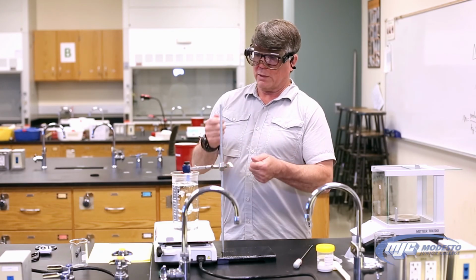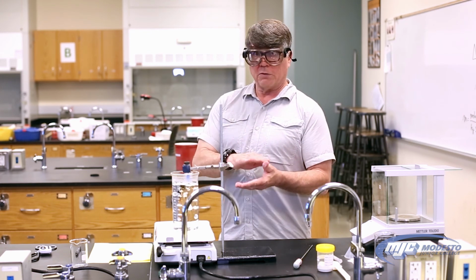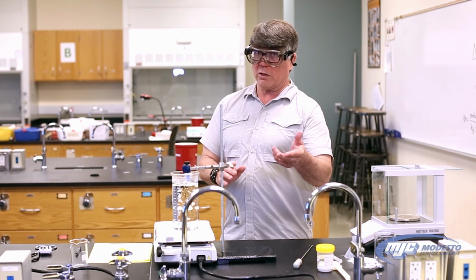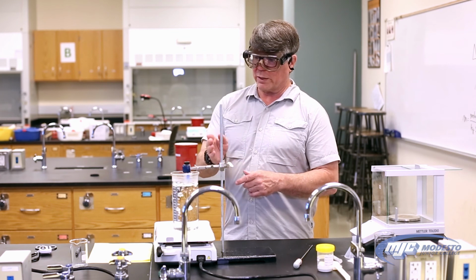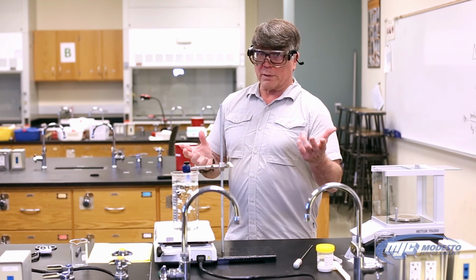Going to take it out, agitate it, record the temperature every 10 seconds until it solidifies. Temperature stays the same for a while and starts decreasing. The temperature that it stays at the longest will be the freezing point of the solution. And that's going to be the experiment.